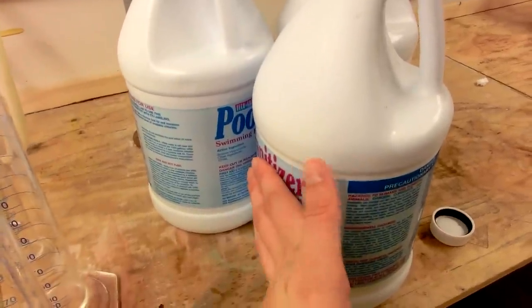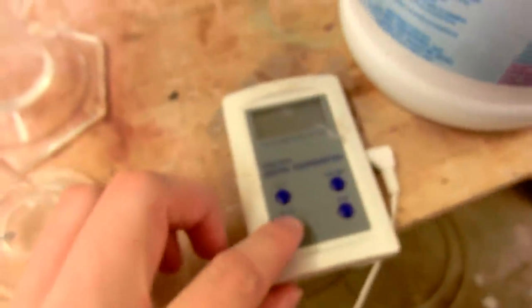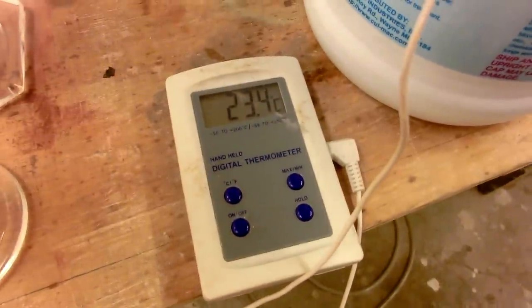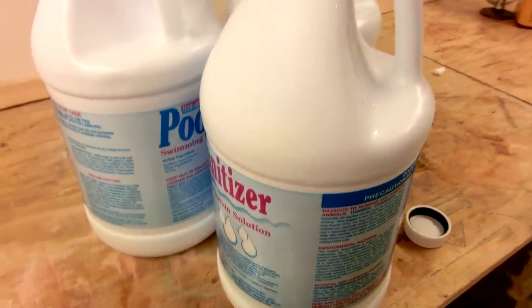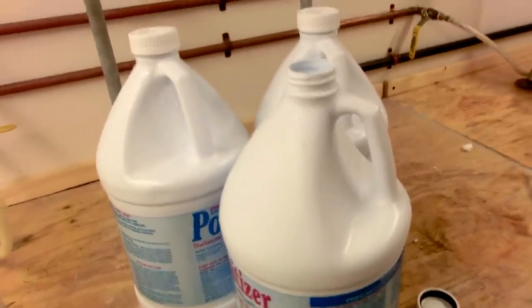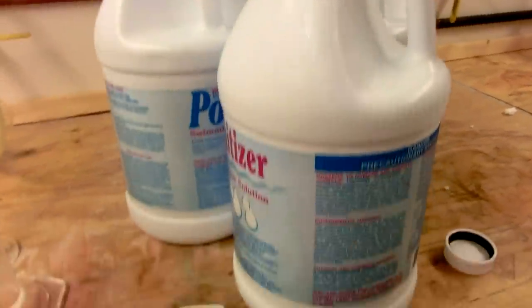The jug has gotten considerably warmer — it's nearly room temperature now, just about three minutes after the last addition of acetone. If you look inside, notice that the green color has completely disappeared, which means our reaction has happened. The temperature went from about 3°C to 24°C just with that addition of 65 milliliters of acetone — a pretty significant and very exothermic temperature increase. Now we're going to wait for the chloroform to settle out. The reaction produces chloroform, which is heavier than water, so it's going to settle to the bottom of the jug.